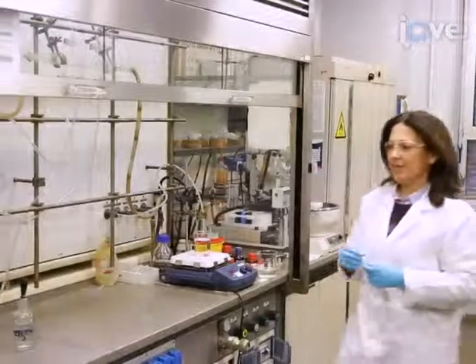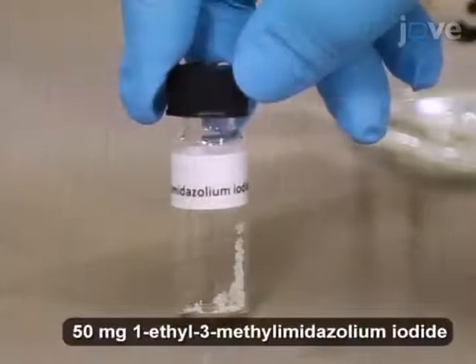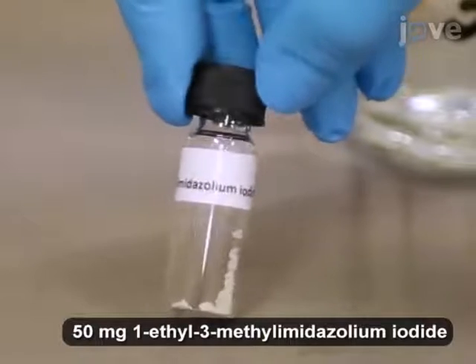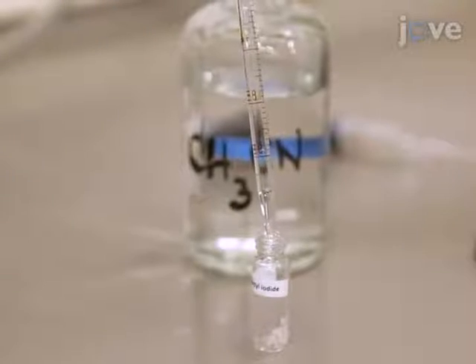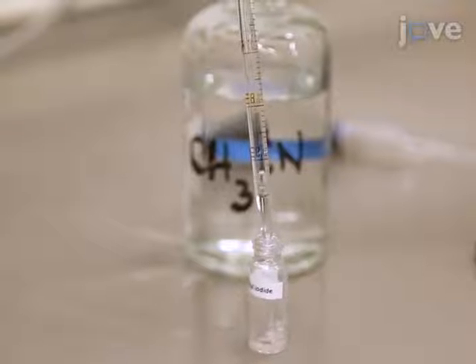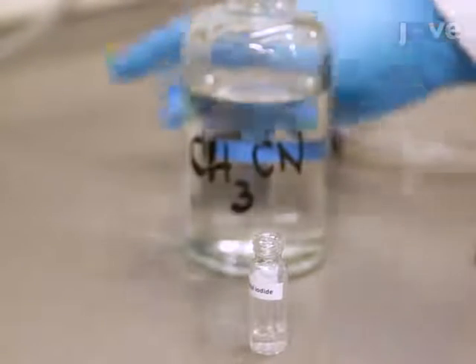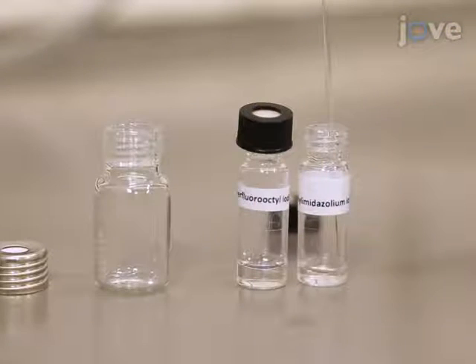To prepare the halogen-bonded complexes from solution, first dissolve 50 milligrams of the imidazolium salt in 0.5 milliliters of acetonitrile. Next, dissolve 229 milligrams of perfluorooctyl iodide in 0.5 milliliters of acetonitrile. Mix the two solutions in a vial.